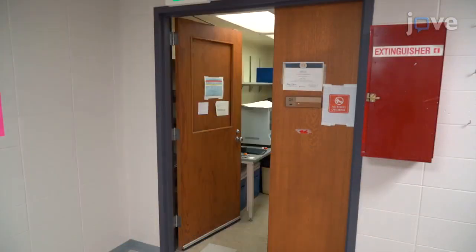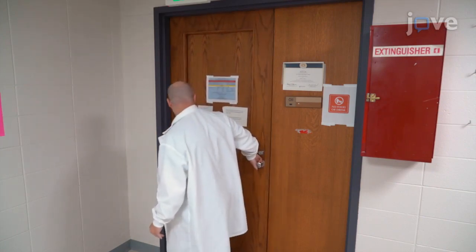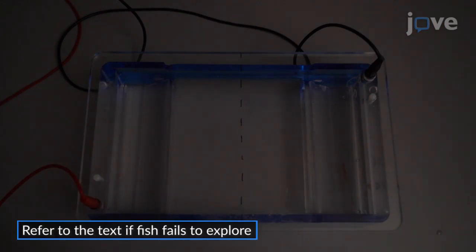The fish should be acclimated in the dark. Turn off all lights and acclimate the fish to the Shuttlebox for 15 minutes. Successful acclimation can be considered when the fish freely explores the tank.